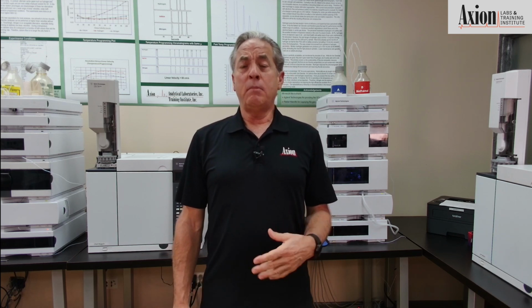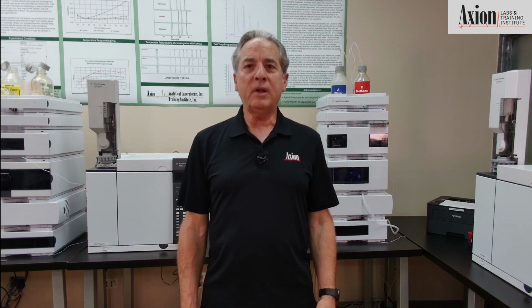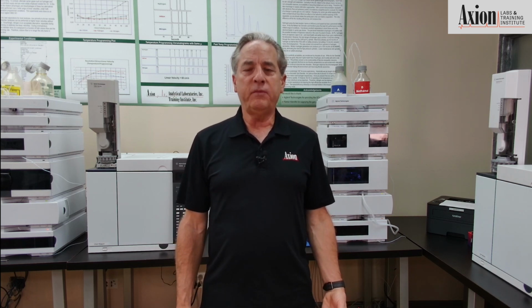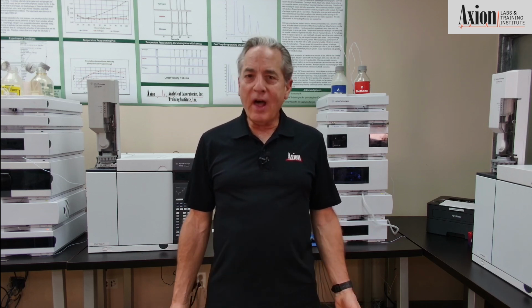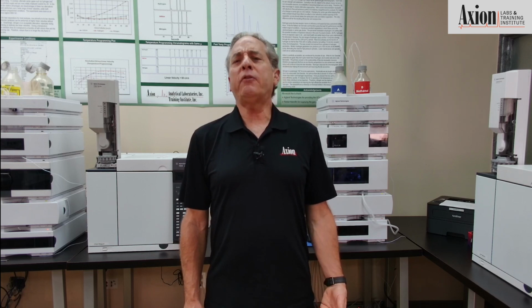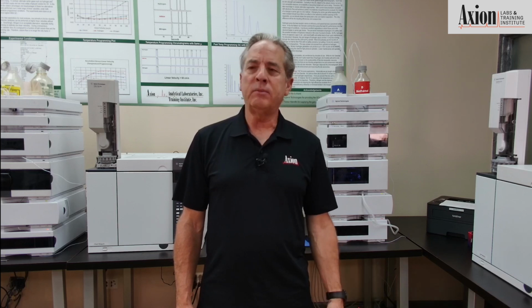analyte. Most analytes will have a positive peak, but some may very well give a negative peak. From a chromatographic perspective, it's totally valid. A negative peak is the same as a positive peak. Peak shape and symmetry and everything still applies. The software can deal with it if you tell it to integrate negative peaks. A little checkbox, integrate negative peaks. It'll integrate them just like positive peaks.